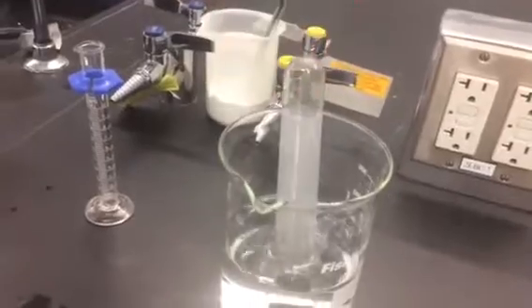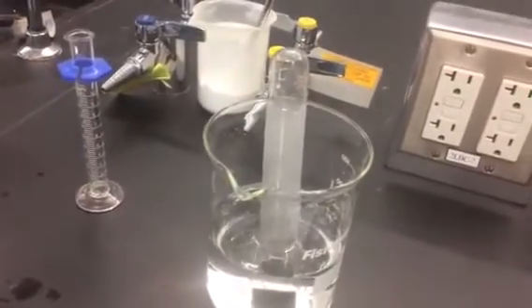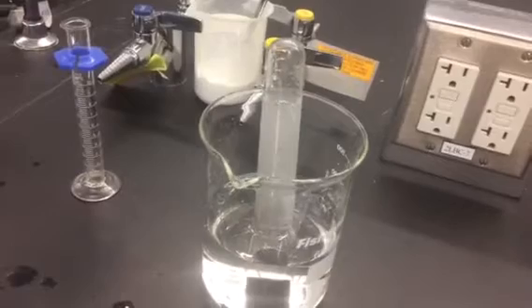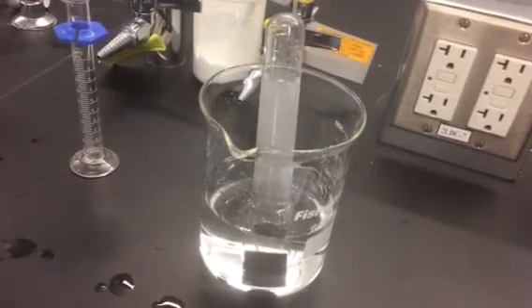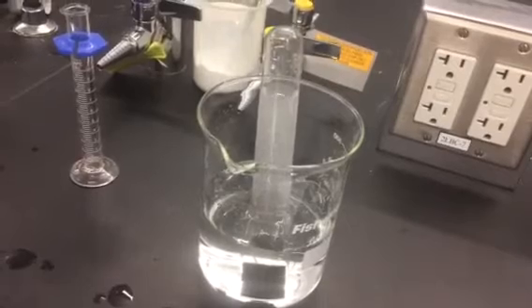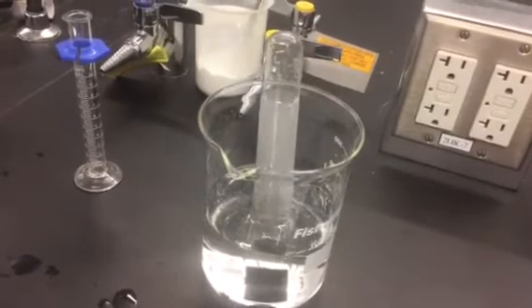You don't have to really worry too much about it. You don't have to hold it or anything since the excess liquid is being pushed out of the hole in the bottom. You can see the bubbles forming and the test tube sort of filling up with that hydrogen gas.